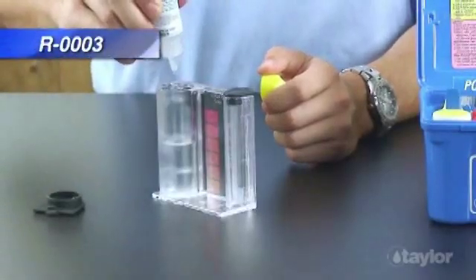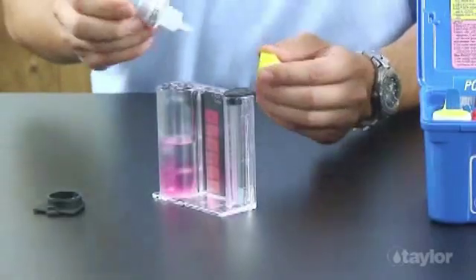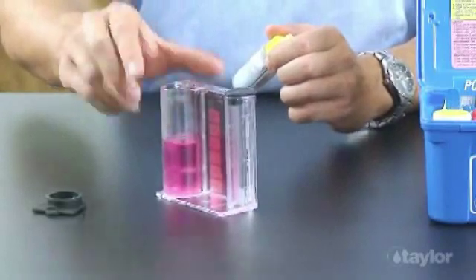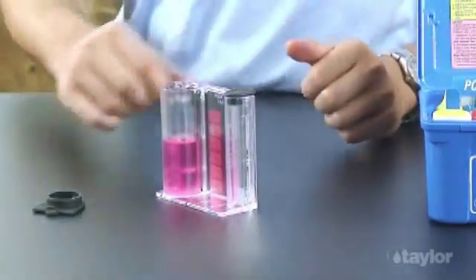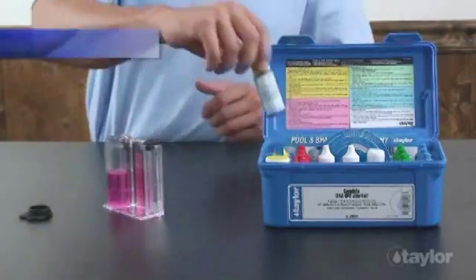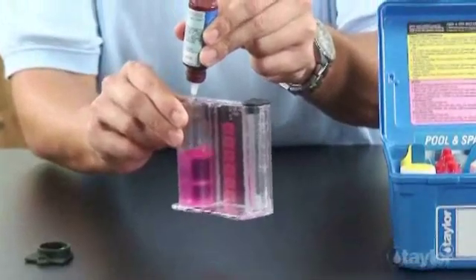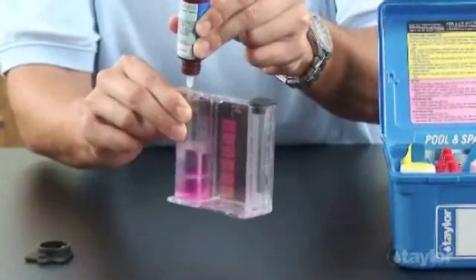Add five drops of reagent 3. Add FAS-DPD titrating reagent for chlorine drop-wise, swirling and counting after each drop, until the sample goes from pink to colorless.